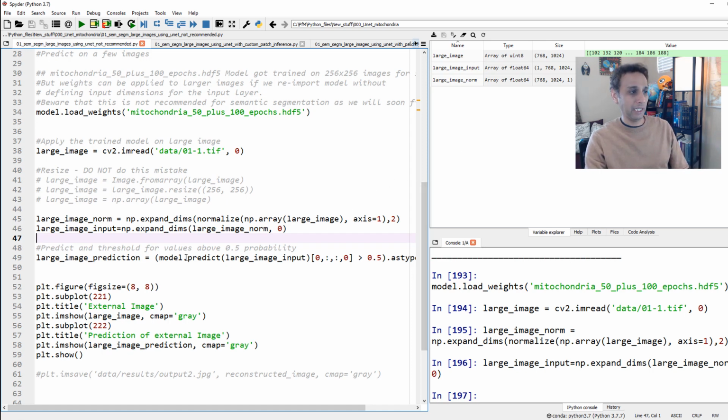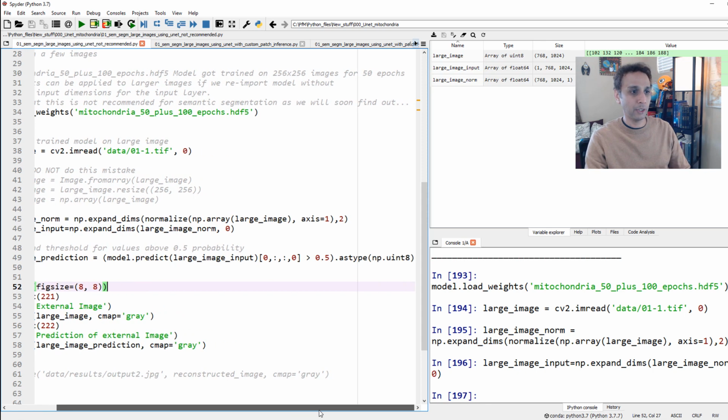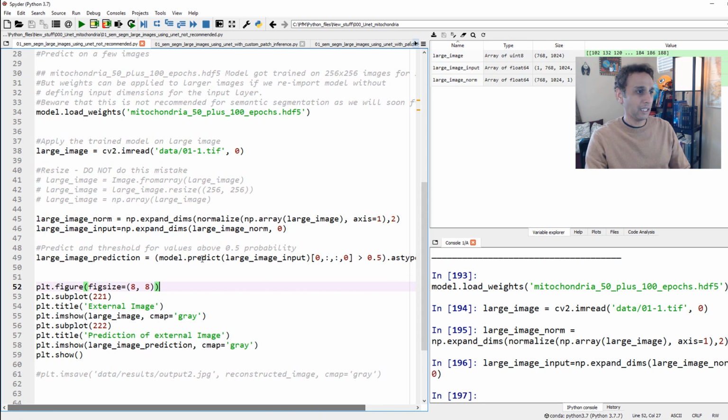Now let's go ahead and predict. Model.predict. And because it's softmax, or even sigmoid, the output of this network, of this prediction, is going to be a probability. I'd like to convert that into semantic segmentation, and because this is a binary case, I'm taking everything above 0.5 probability as true, everything below as false, right? That's exactly what I'm doing, and I'm converting that into an unsigned integer 8. That's what this line is doing.